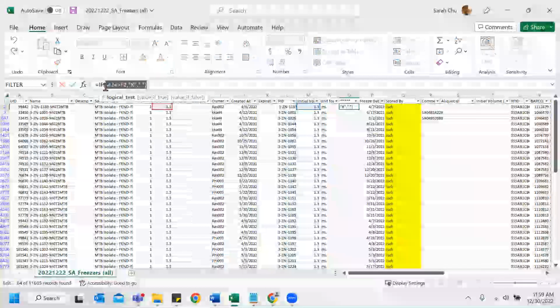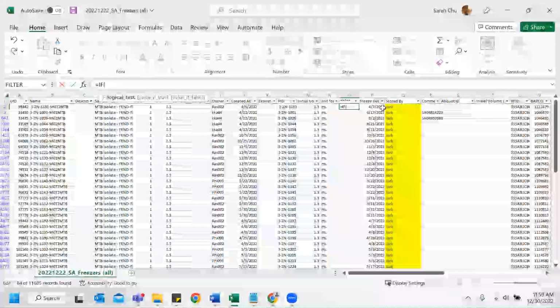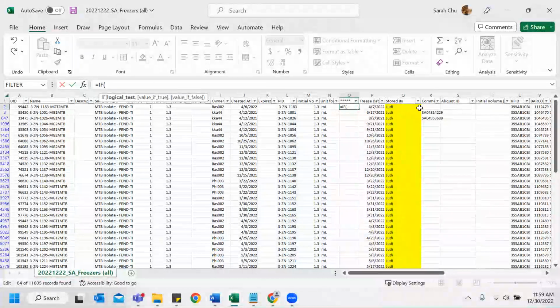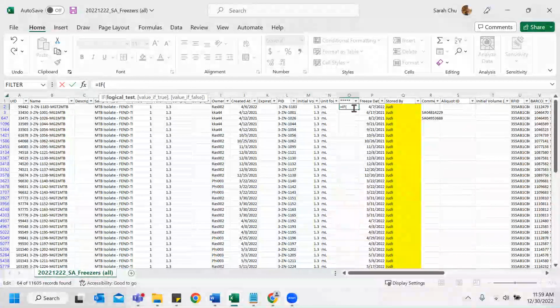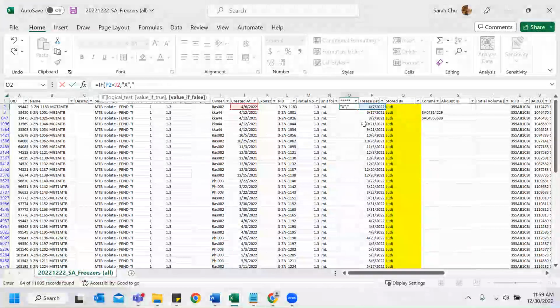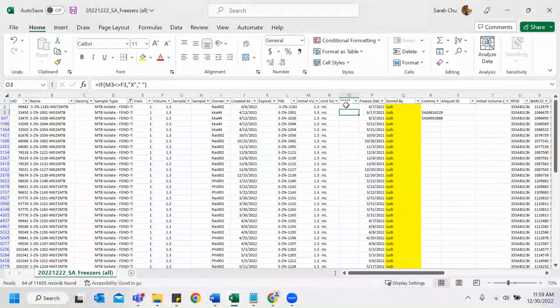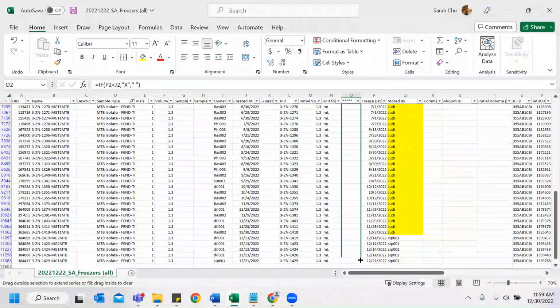So next, what I'm going to check for is whether the freeze date is incorrect. Freeze dates should always be after creation dates. Some people mistake the two different columns, or they type something by accident, like a different year or a different date. So we're just going to confirm the freeze date. If the freeze date is before the creation date, you add X. And I drag at the same time. Oh, okay, I guess I can't drag in this.